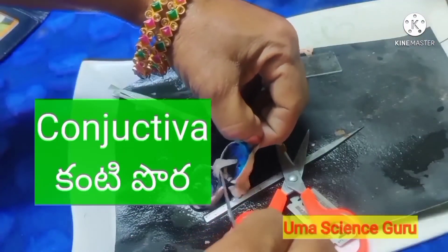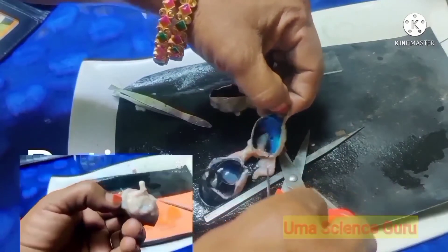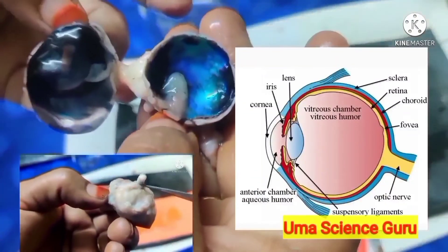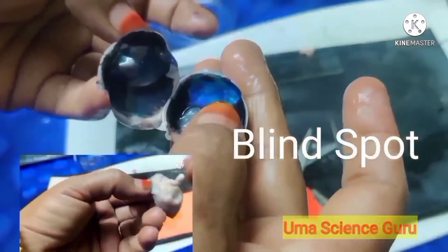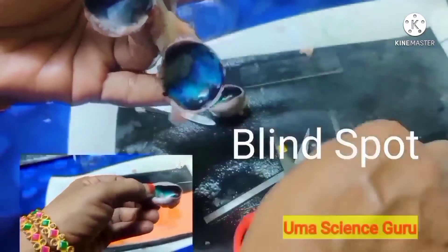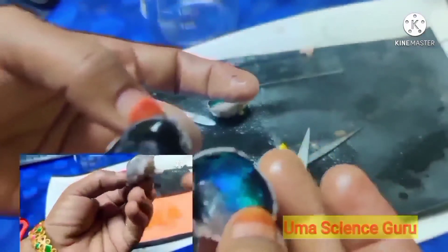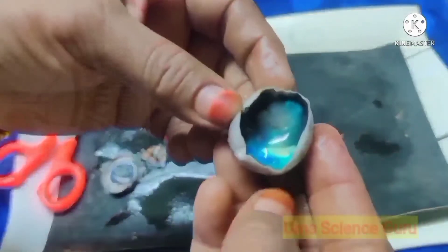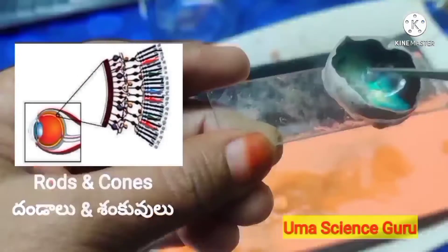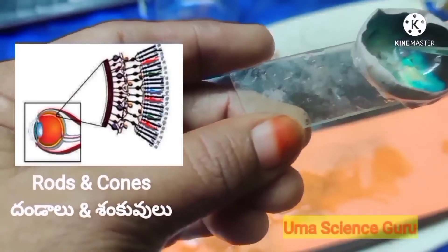Students, let us observe the innermost layer — the actual sensory part of the eye — the retina. Observe the point where the optic nerve is connected to the retina. There are no rods and cones at this point, so there is no vision here. This point is called the blind spot. The real work in the retina is performed by light-sensitive cells known as photoreceptors, which consist of two types of specialized cells: rods and cones.